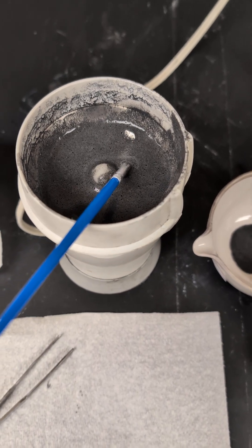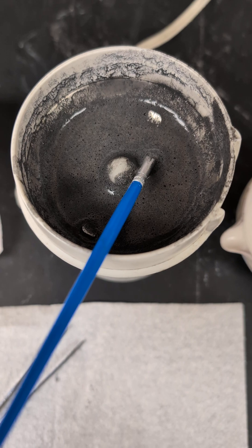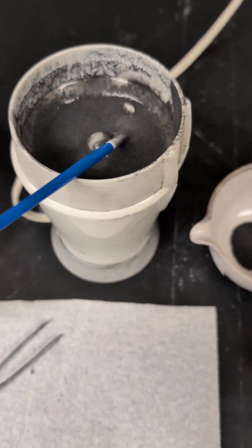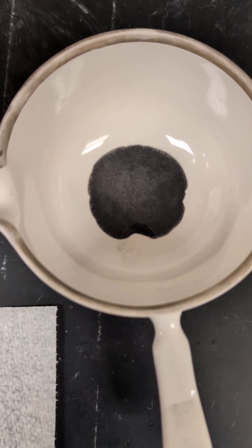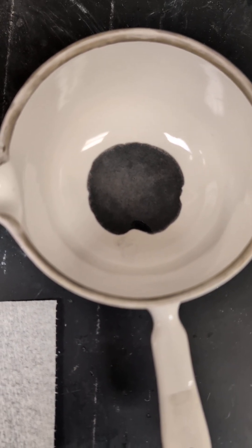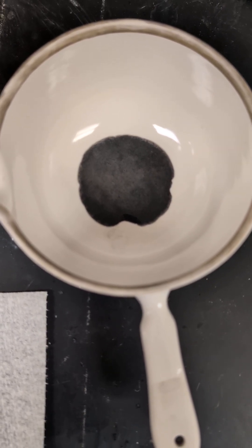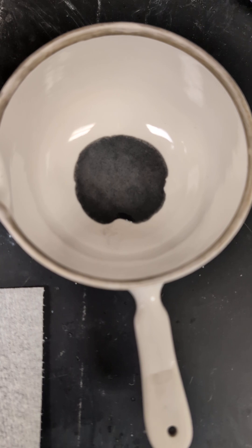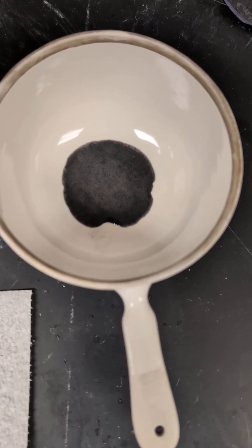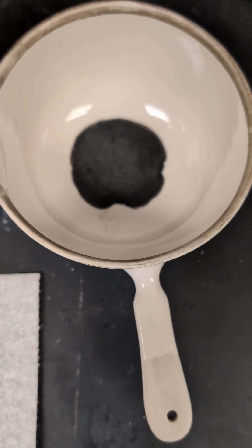Hi YouTubers. A composite being made by two of my undergraduate students using a coffee grinder, containing CMC binder, water, expanded graphite in a certain amount — details on the amounts will be given later in the write-up — and halloysite, a white nanotubular clay, and activated carbon, sieved very fine.